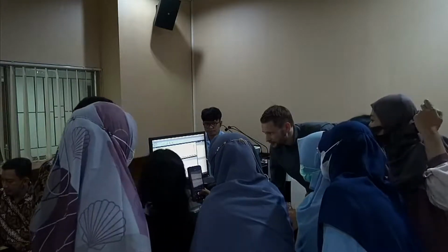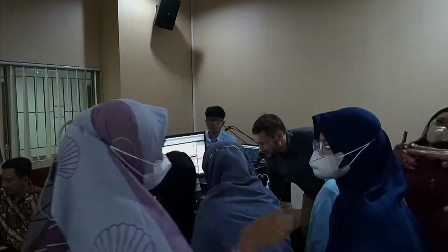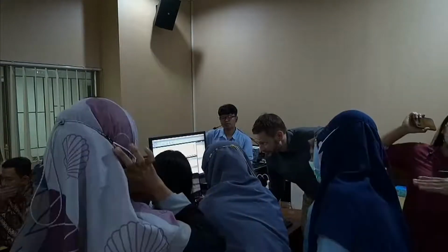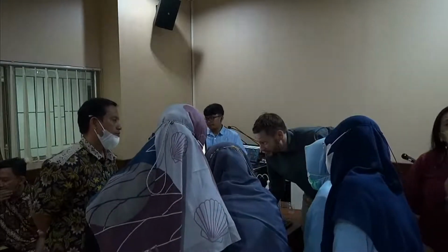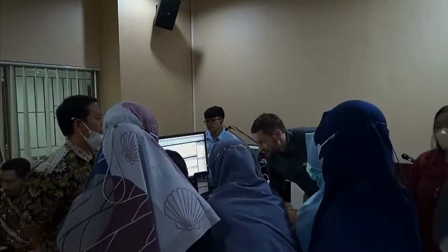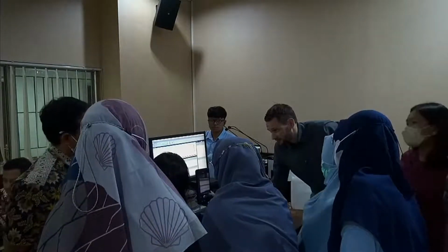So you can also see this here as a table for sizes. In this, you have the size first. For example, 10 micrometers. You see 20% of the sample is smaller than 10 micrometers. Already 56% is smaller than 25 micrometers. So you see it's a big chunk of material between these 2 sizes. That's basically how you read the tables.